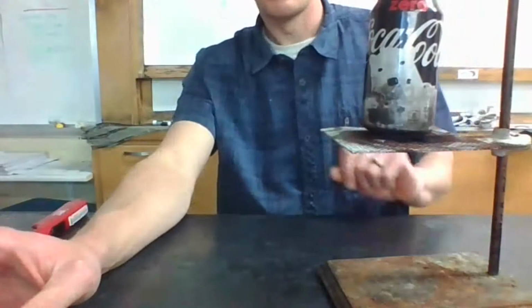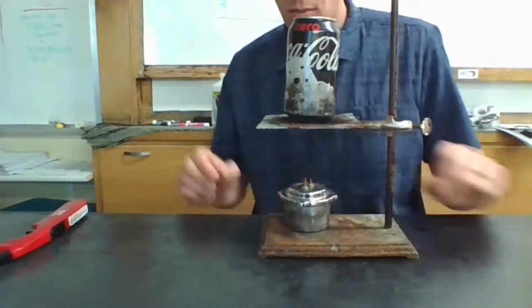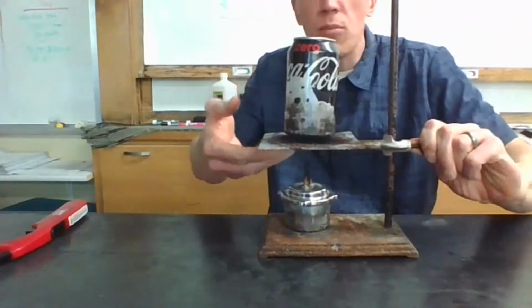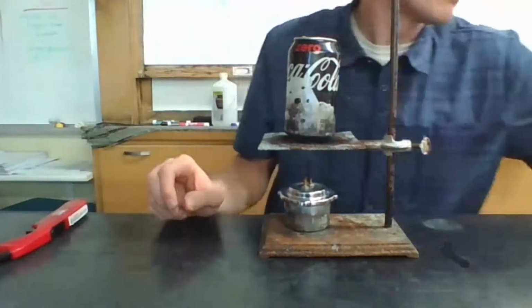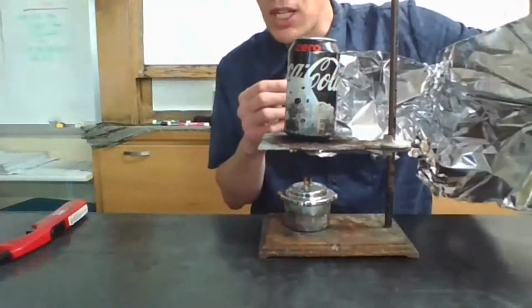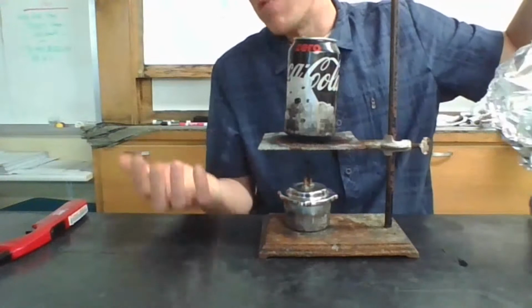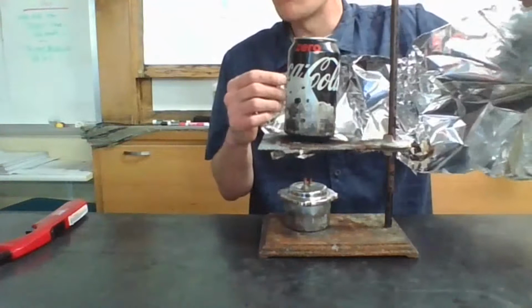All right, put this up here. Maybe I can move it back so you get a little bit better view. Put this guy under here, and I'm about ready to go. Let me go ahead and lower this down a little bit. Now, this is a pretty rudimentary setup. It's not going to be great, but it's going to allow us to practice some of the math we've got. Now in class, I surrounded this thing as much as I could with a heat shield, with some aluminum foil, to try to funnel a bunch of heat up to here, because clearly, can I guarantee when this is burning, all the heat's going to go into this can? No, but we'll do what we can. So we'll at least try to compensate for heat loss, our major source of error in this experiment, a little bit.